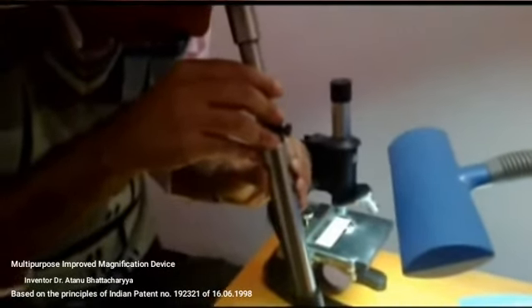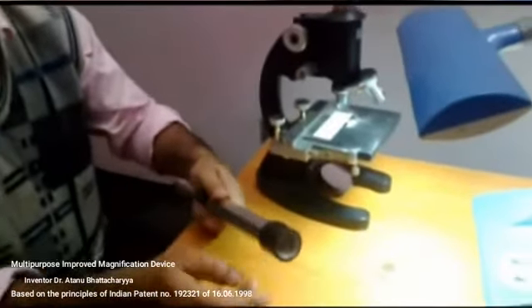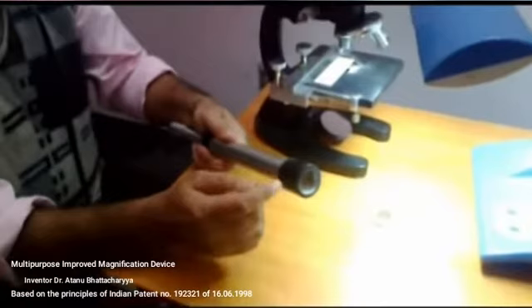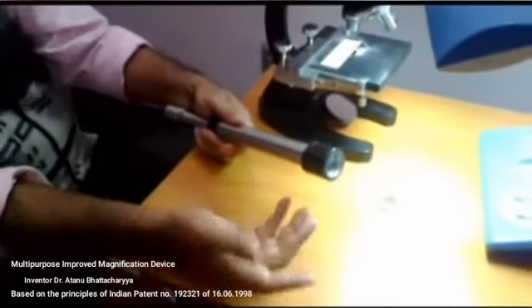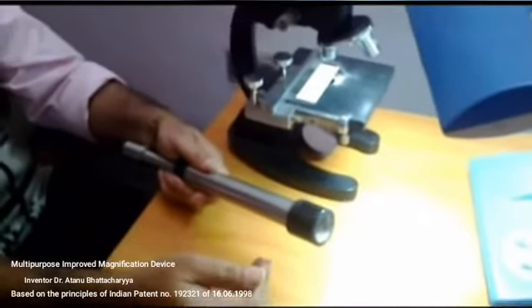This is the field microscope. By this microscope, insects, fossils, etc. can be seen very clearly, and the aperture of this lens is very high, so it can accept a much greater amount of light. So in ordinary daylight, insects or fossils can be seen very clearly.